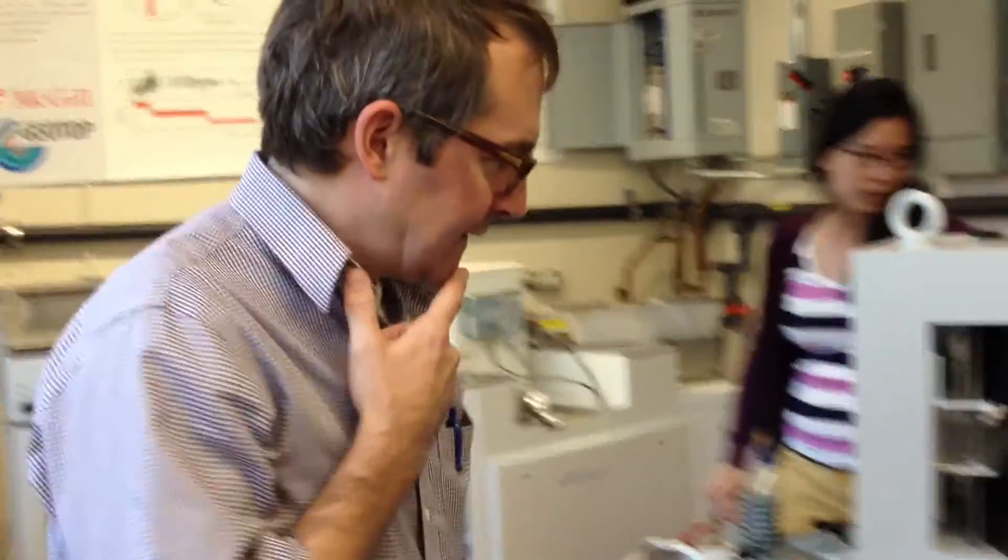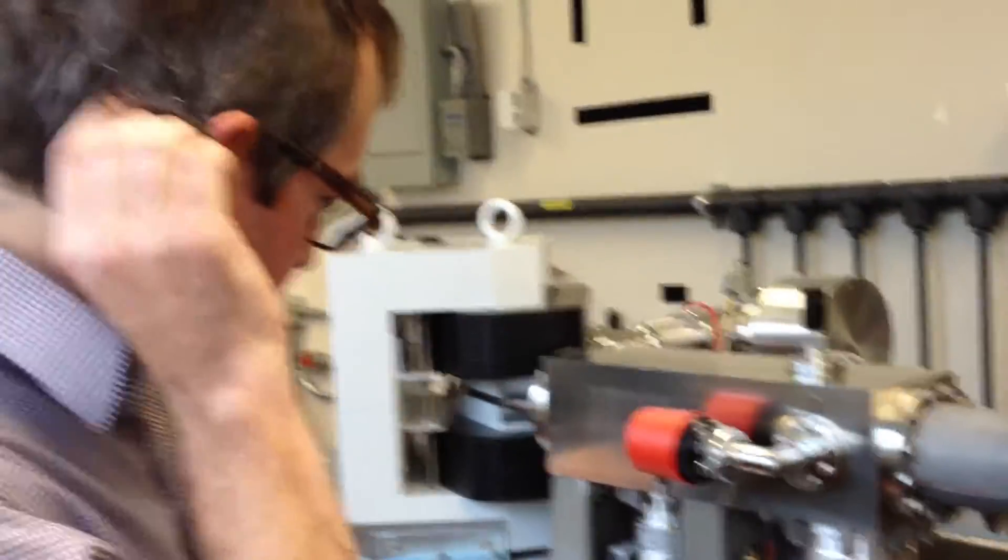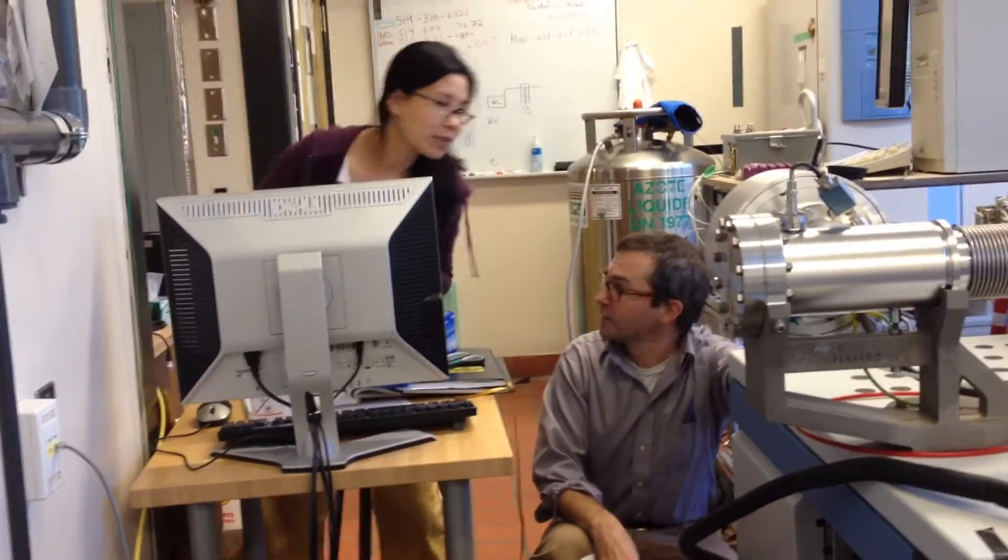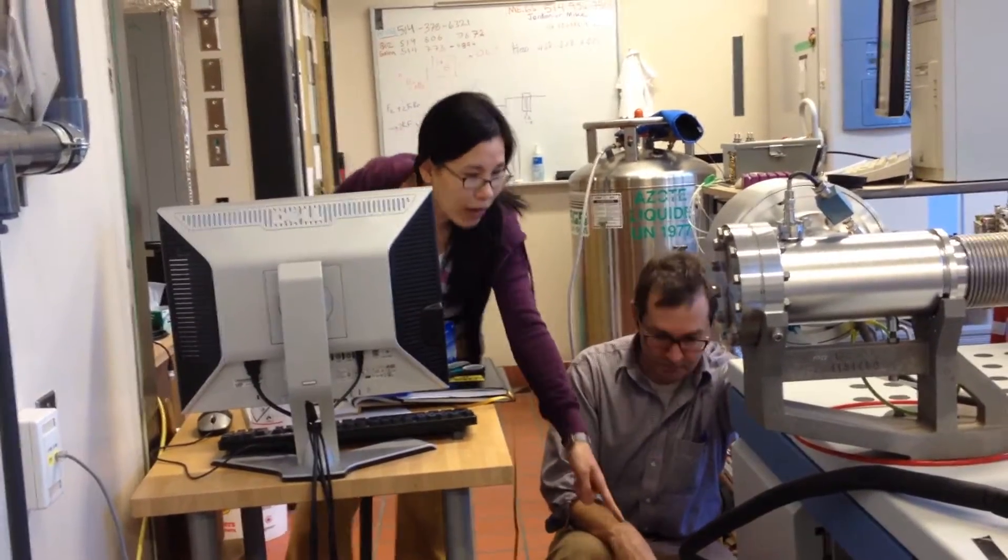And because nothing's ever perfect, eventually your analyses get less and less precise, and you have to do what we were doing the other day when you came in, which is kind of turn the thing off and tear open its guts and give it a good cleaning inside, and then put it back together and hope that everything works.